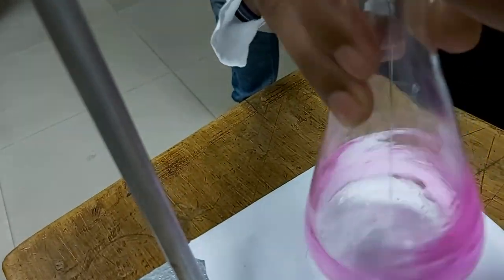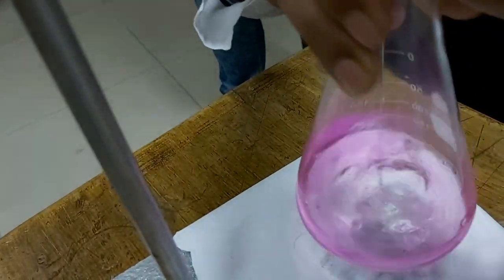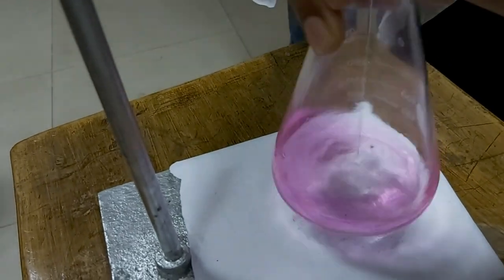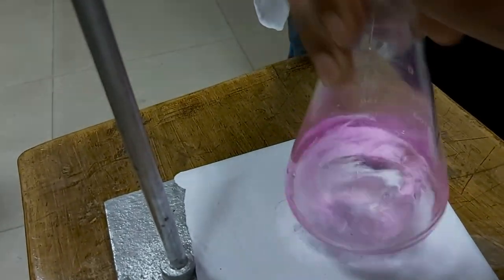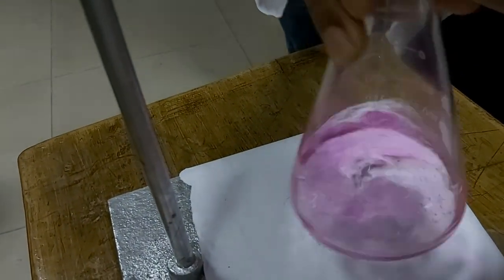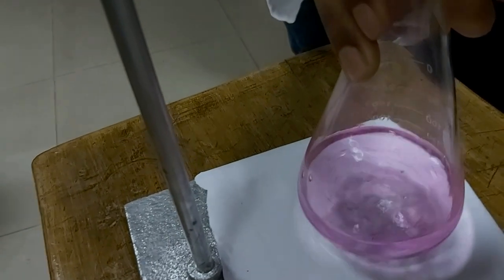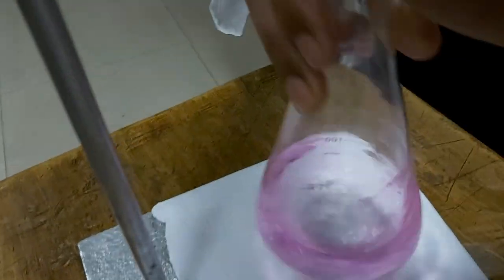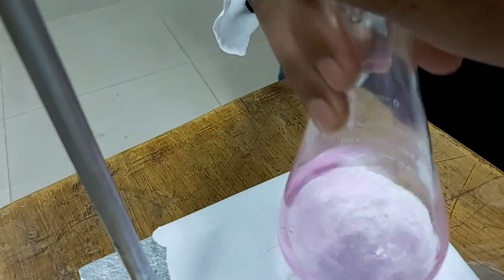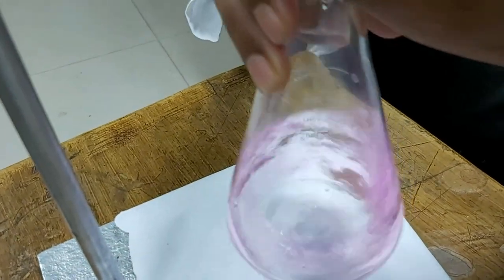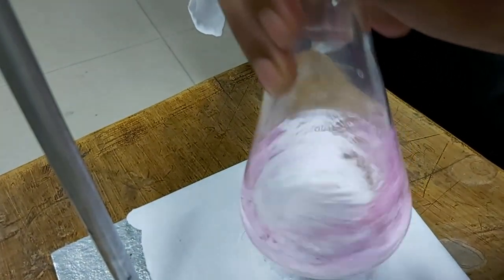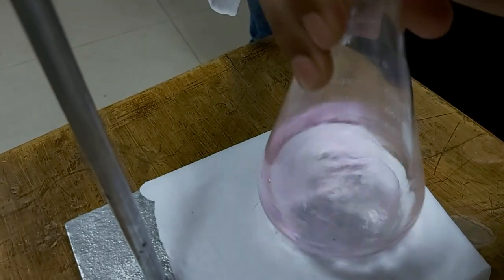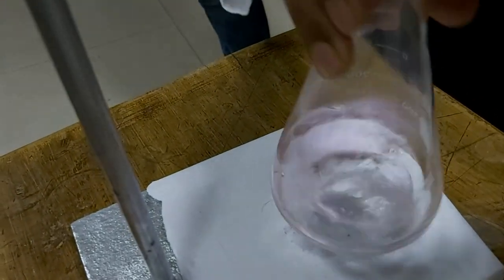It can be done this way since we have gathered experience. The whirlpool is appearing. At the endpoint, one should be very precise while adding the acid solution to the base solution. Now he is adding dropwise so that the titration should not overshoot.